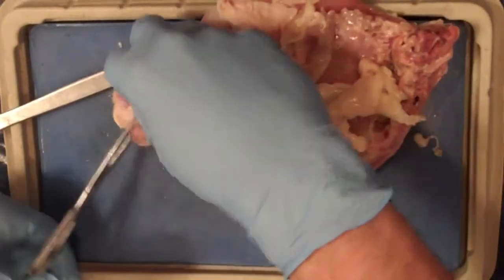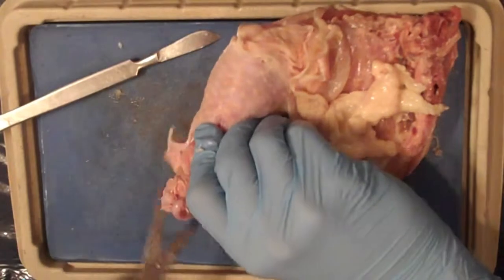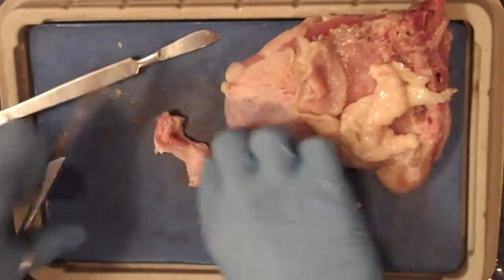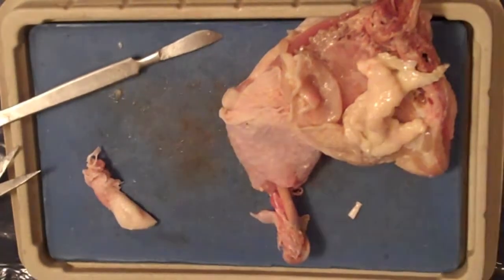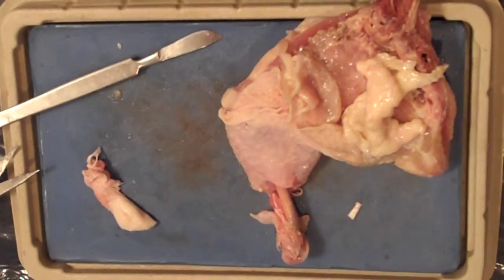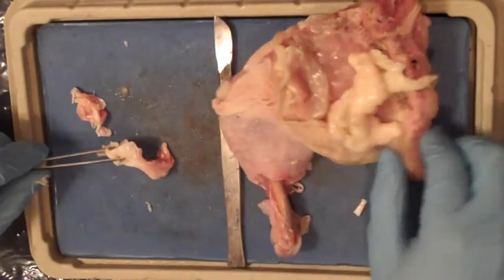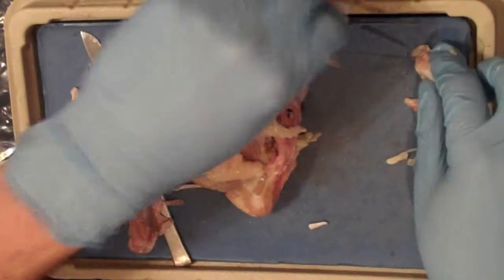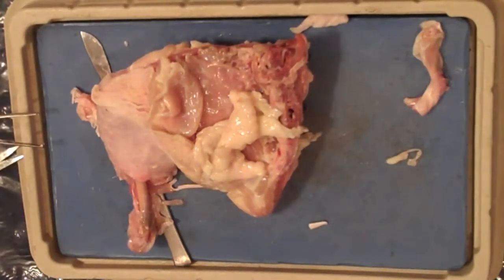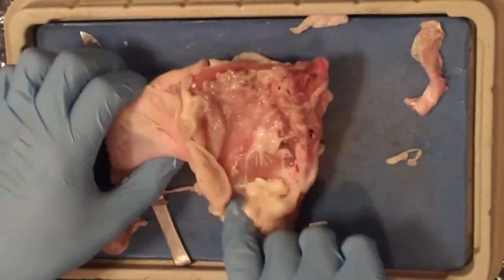Now you're going to want to try to remove the cartilage that's found at the end of the bone. Again, you may not be using the leg bone, but your bone should still have cartilage at the end of it. The cartilage is opaque and white. It won't be easy to remove, so take your scalpel and scissors and cut away at it until you can remove it. The fibers in cartilage are slightly more elastic than the fibers in bone. It also doesn't have the calcium deposits the bone has, making it a little bit more flexible. Compare the cartilage to the bone.